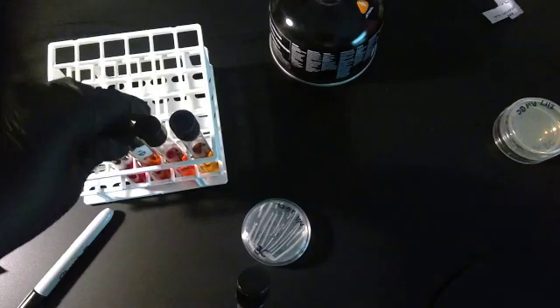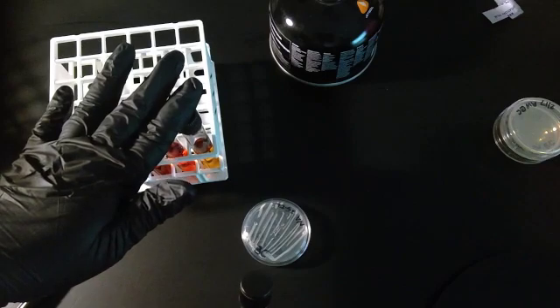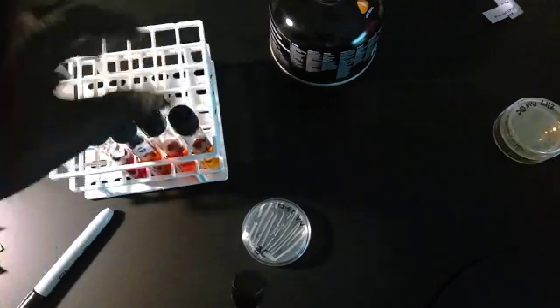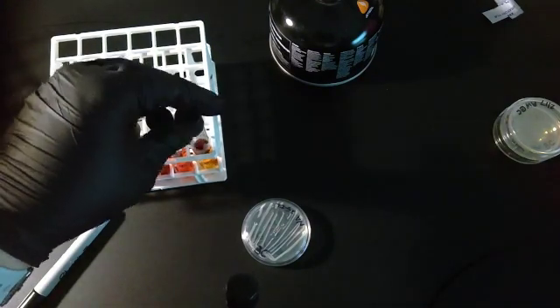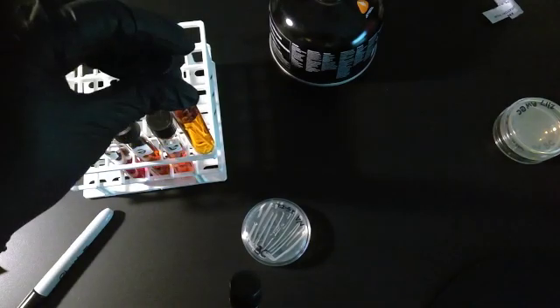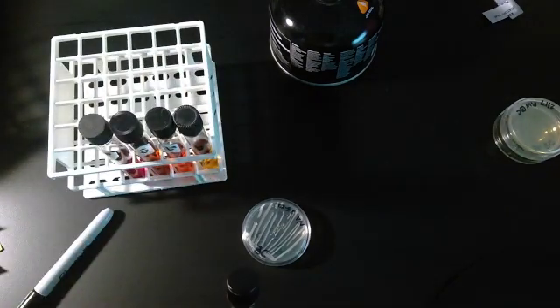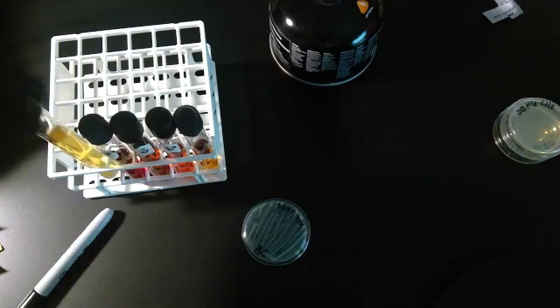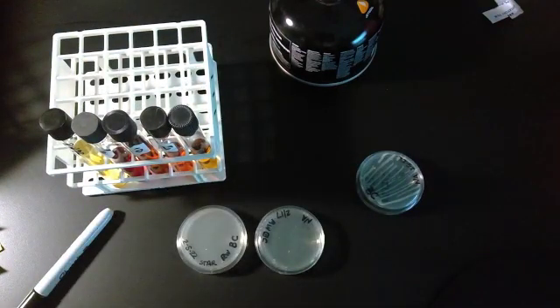We have our phenol tubes. We're looking for acid production, which means that it ate the sugar that's in there, specifically, whether it's sucrose, dextrose, lactose, or maltose, and produced acid. And with the Durham tube that's in there, see how there's no air in there? We're going to see if there's any air after it's incubated for 48 hours. These are the biochemical characteristics experiments that you do.